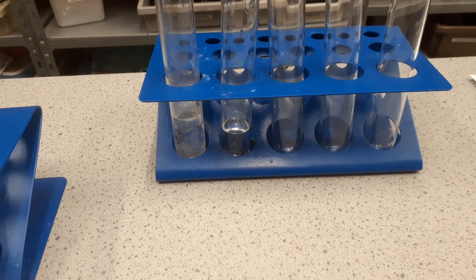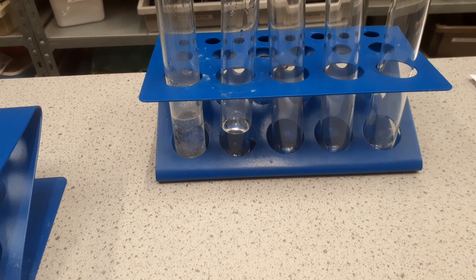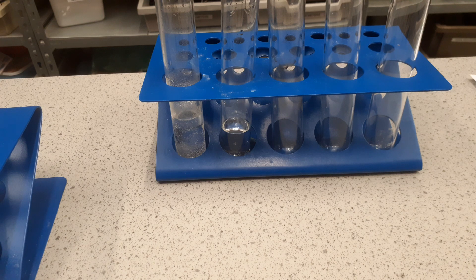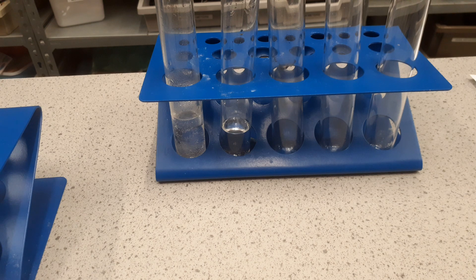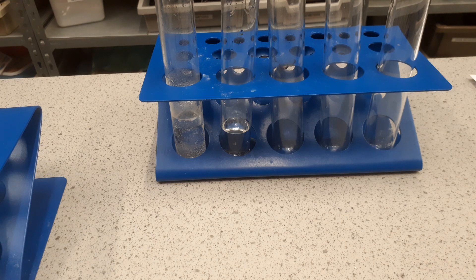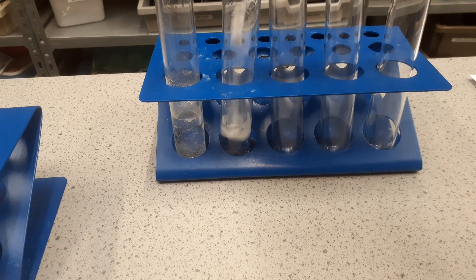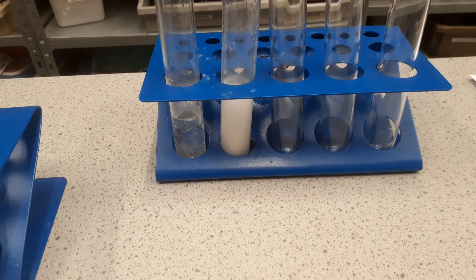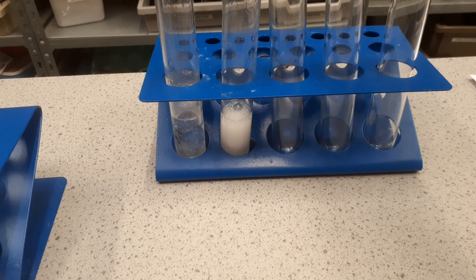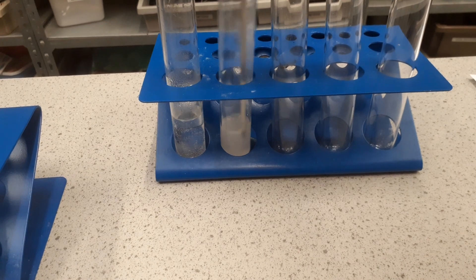Moving on to our second experiment. This time we're still going to use hydrochloric acid. The start temperature will be the same as the previous, 18.1 degrees C. I'm going to add sodium hydrogen carbonate to it and then we'll take the final temperature. As you can see, it fizzes up quickly.